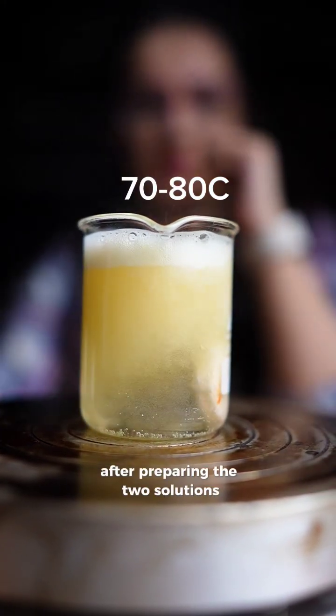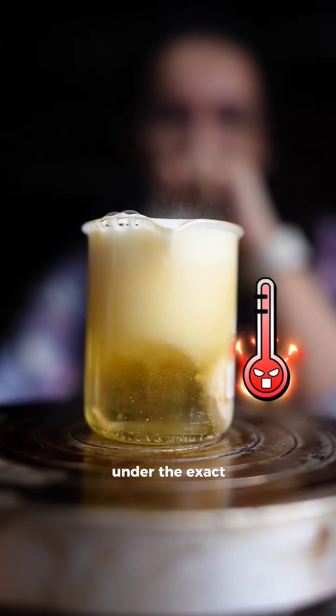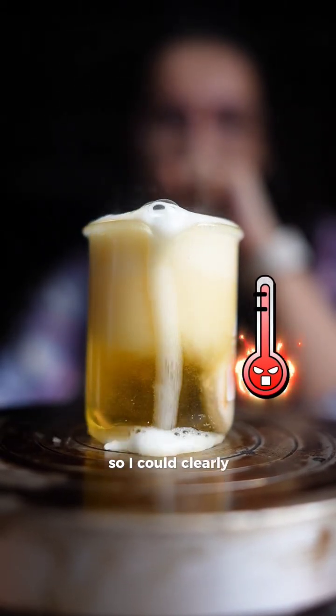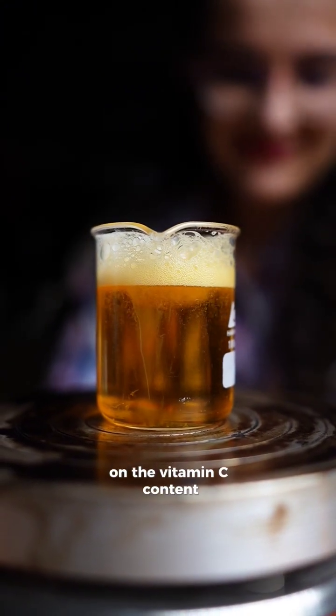After preparing the two solutions I added one effervescent tablet to each under the exact same conditions so I could clearly compare the effect of temperature on the vitamin C content.